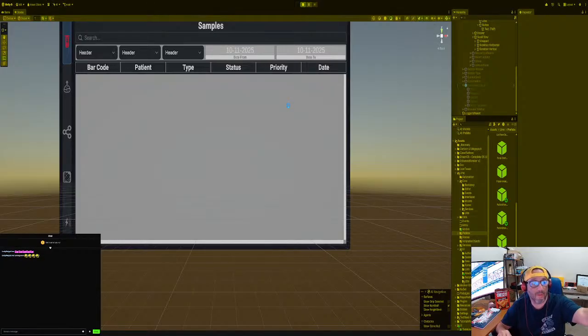which you see right here, and then did some filtering, which you see right there. While I was building that out, I thought, hey, I might as well just do it with a video. We could figure all this out together.